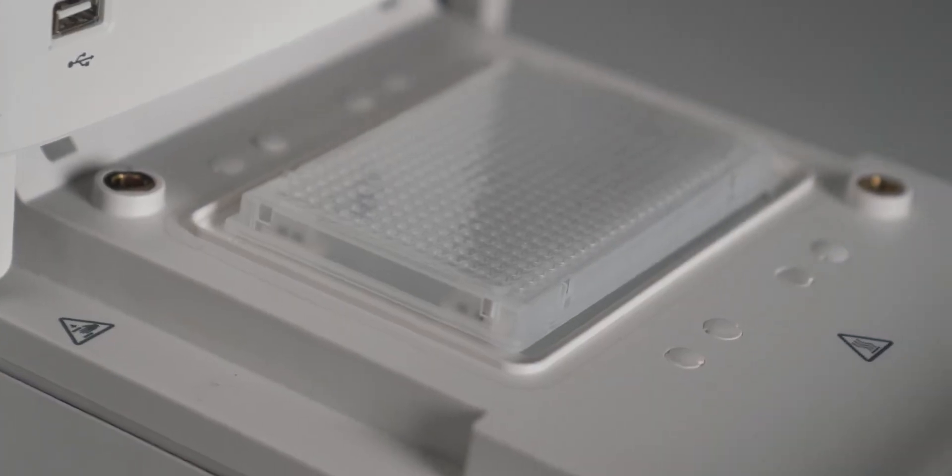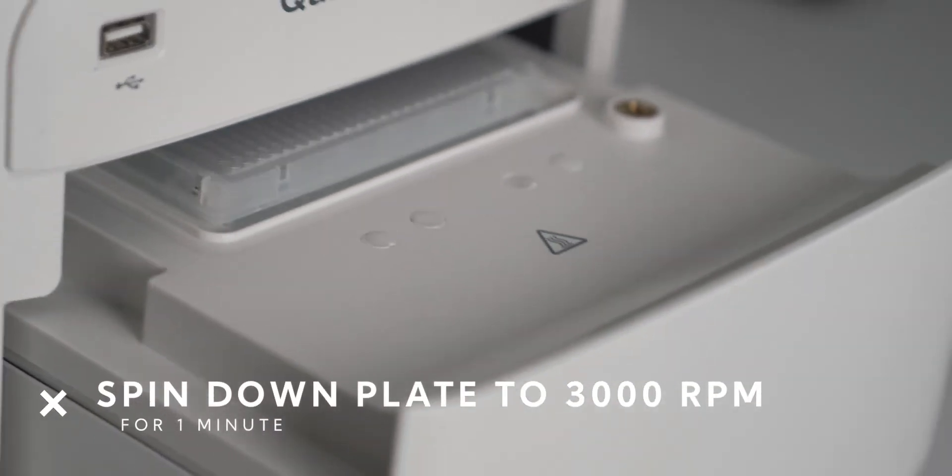When everything is sealed, make sure to spin down your plate around 3000 RPMs for a minute and it's ready to go.